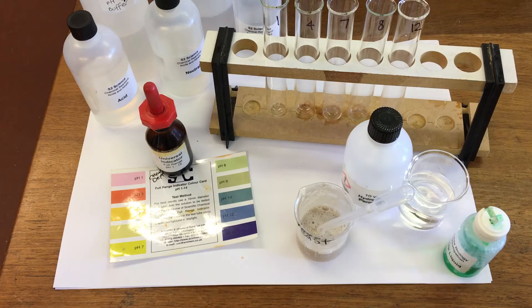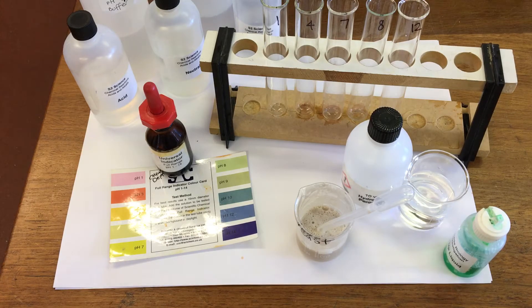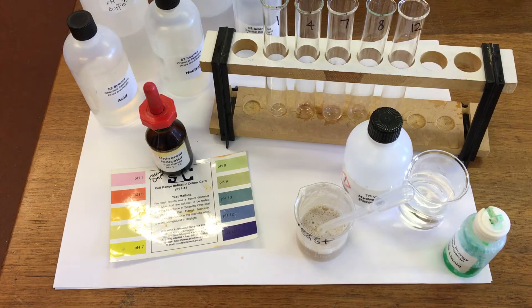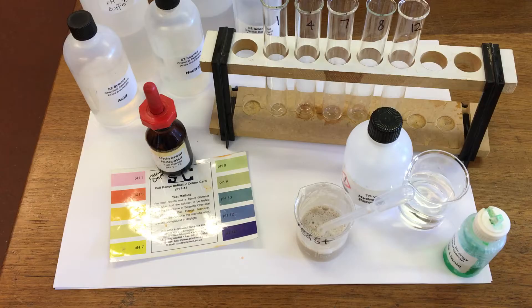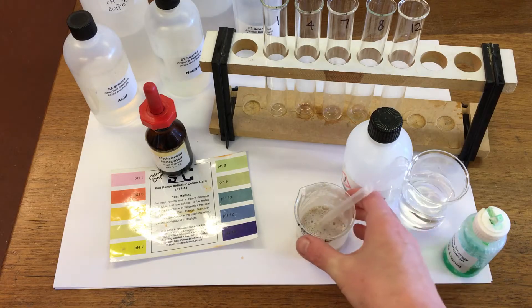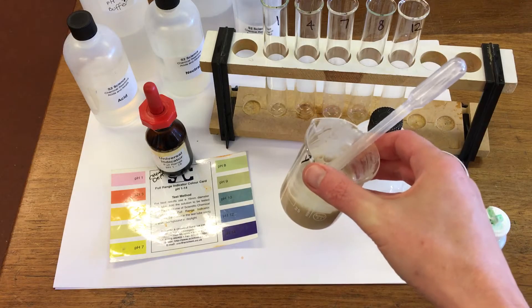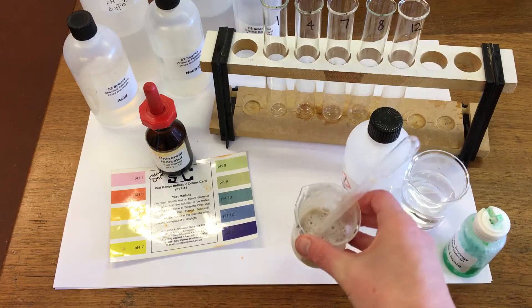In this experiment, we're going to look at the effect of pH on enzyme activity. I'm going to use some yeast solution, which is a source of catalase enzyme.